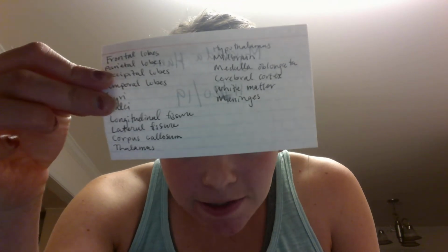Here's my note card, my name, and then on the back, just a list of topics to talk about in this video. I'll put that right over here. So first, I'm going to start with the cerebellum.